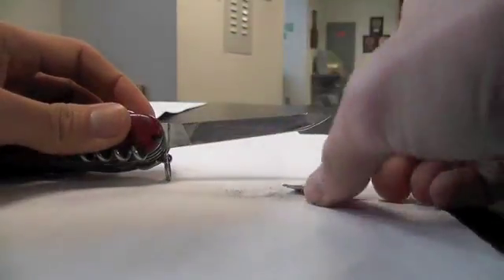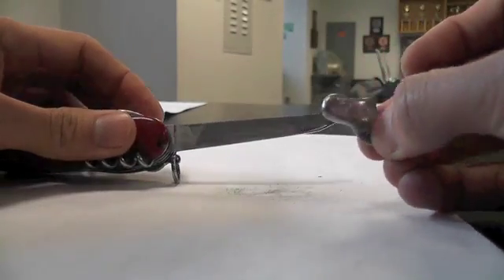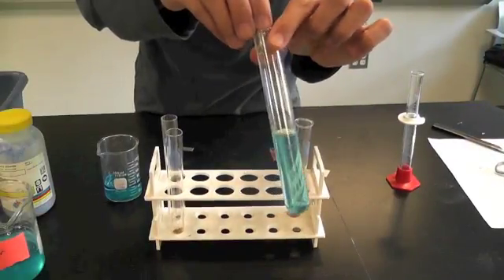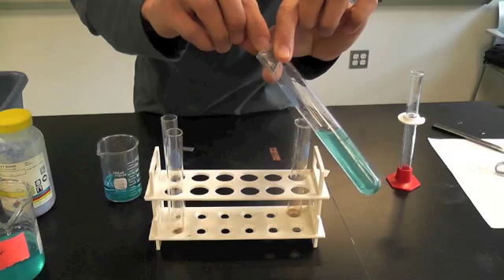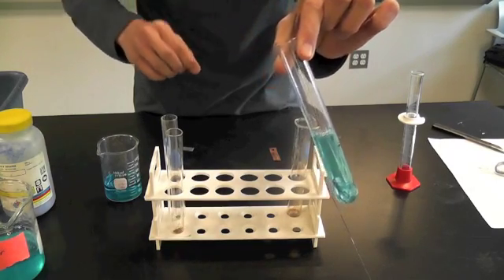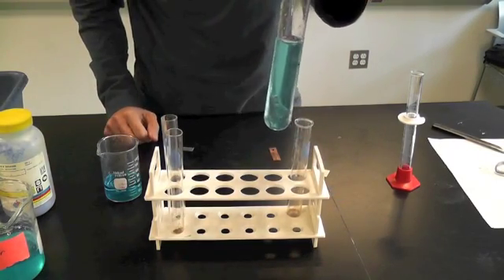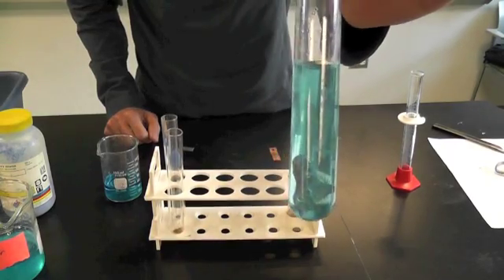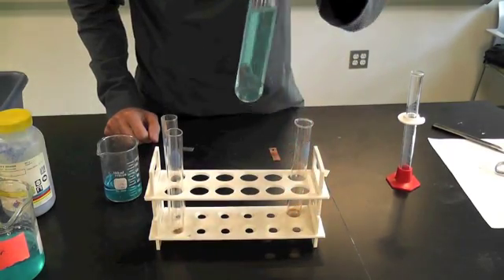So I'm just going to file it, scuff it up. You'll see it makes it a little bit shinier underneath. Place a piece of lead right in there. Let it slide in all the way to the bottom. And let's take a look and see what happens.